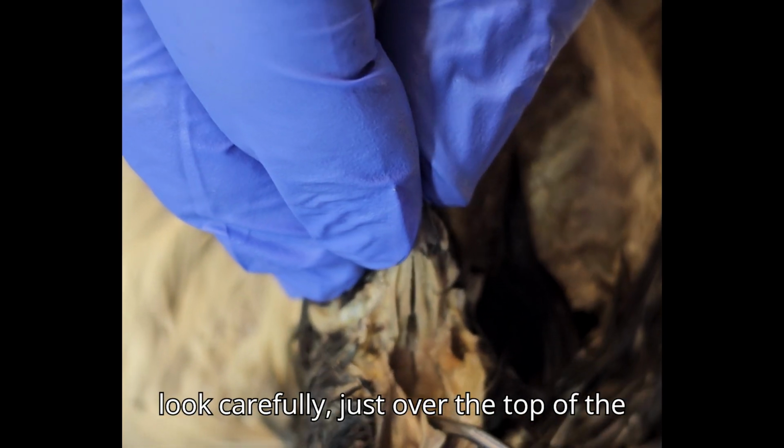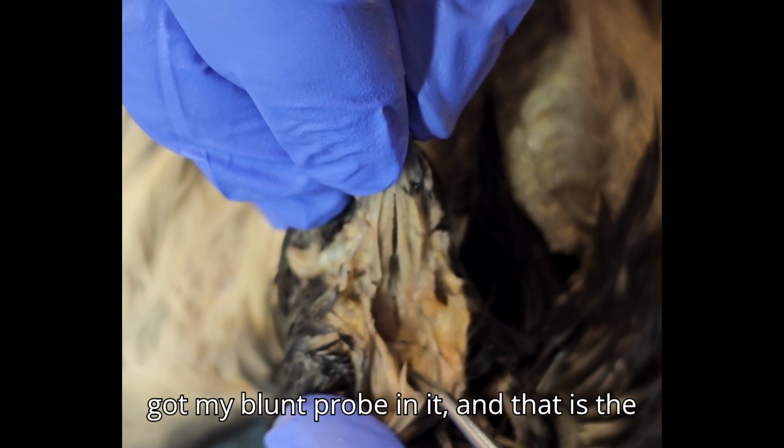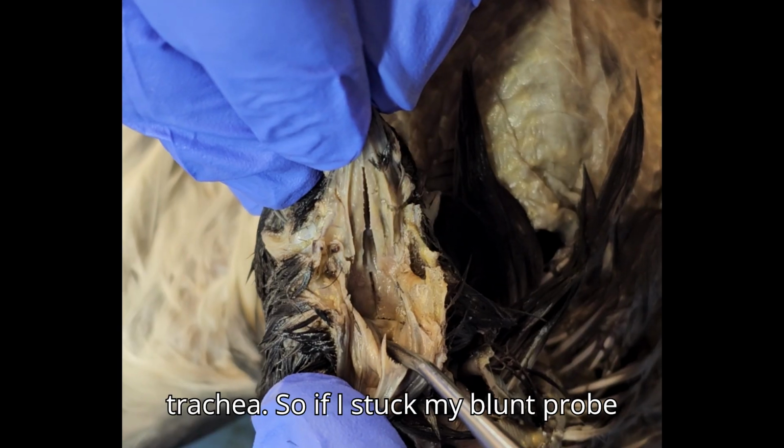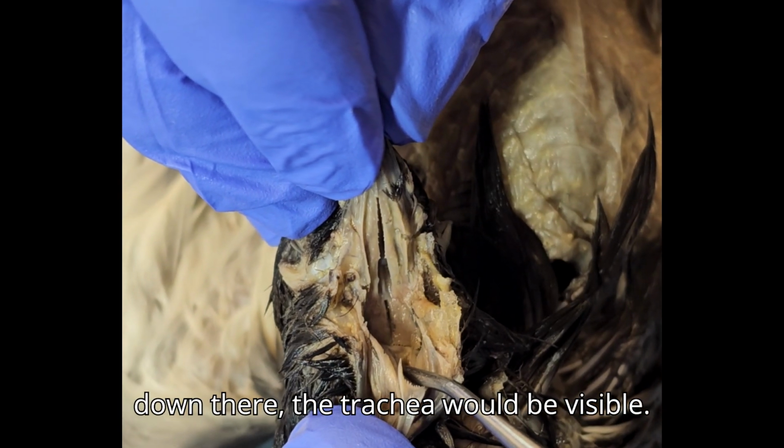And if you look carefully, just over the top of the tongue, there's a slit right there. I've got my blunt probe in it, and that is the glottis. That's going to open up to the trachea. So if I stuck my blunt probe down there, the trachea would be visible.